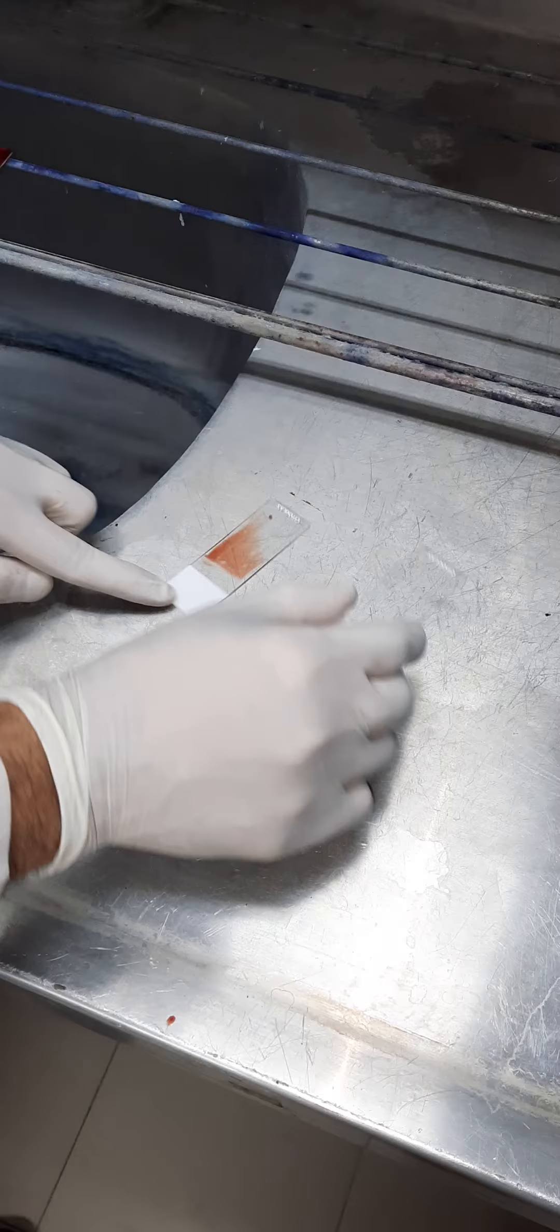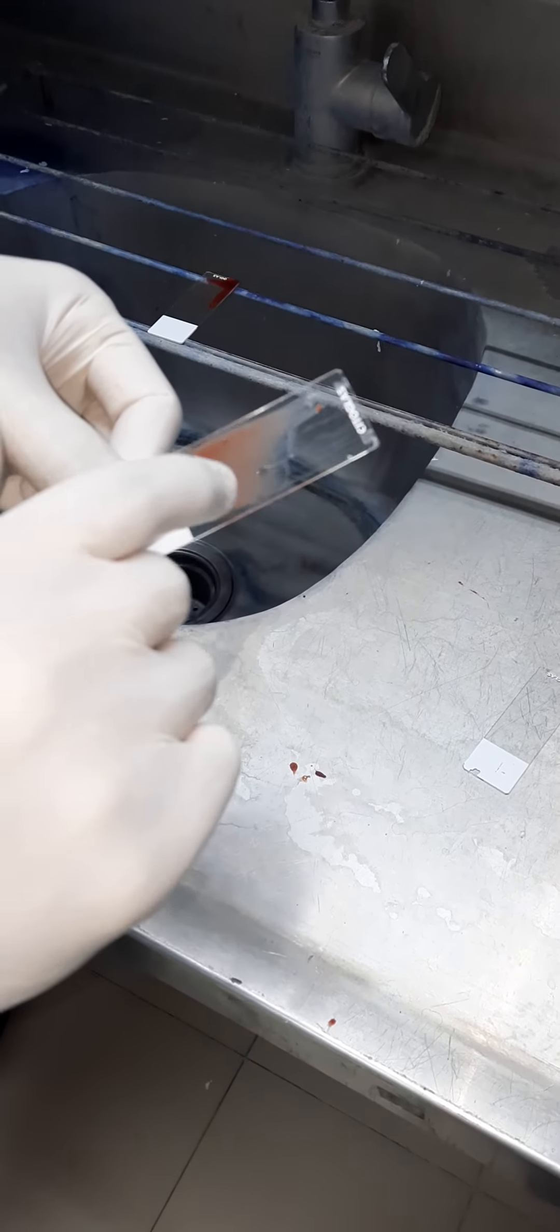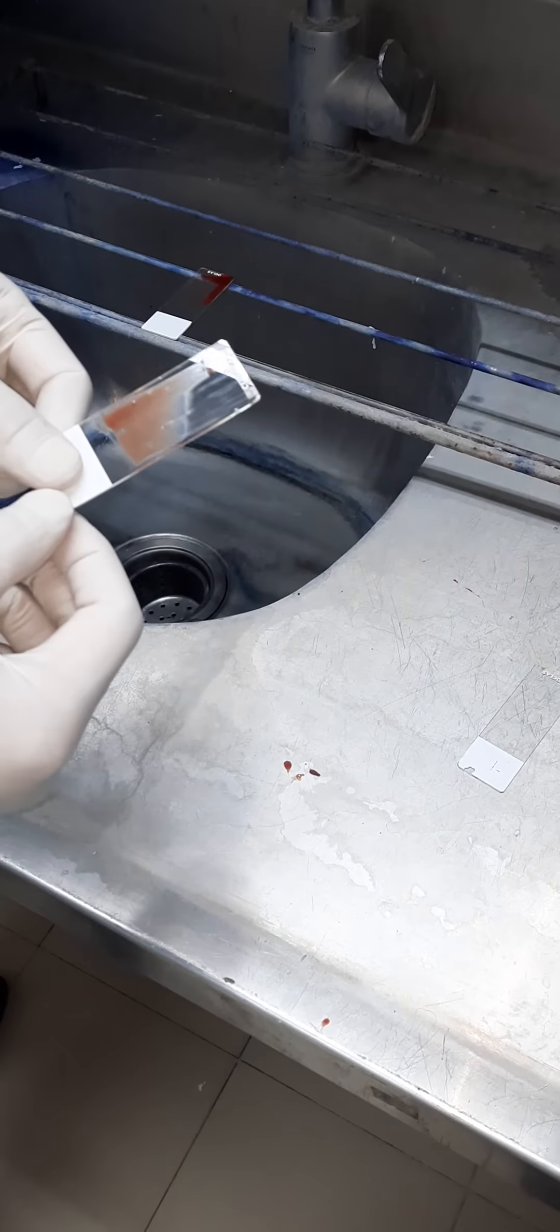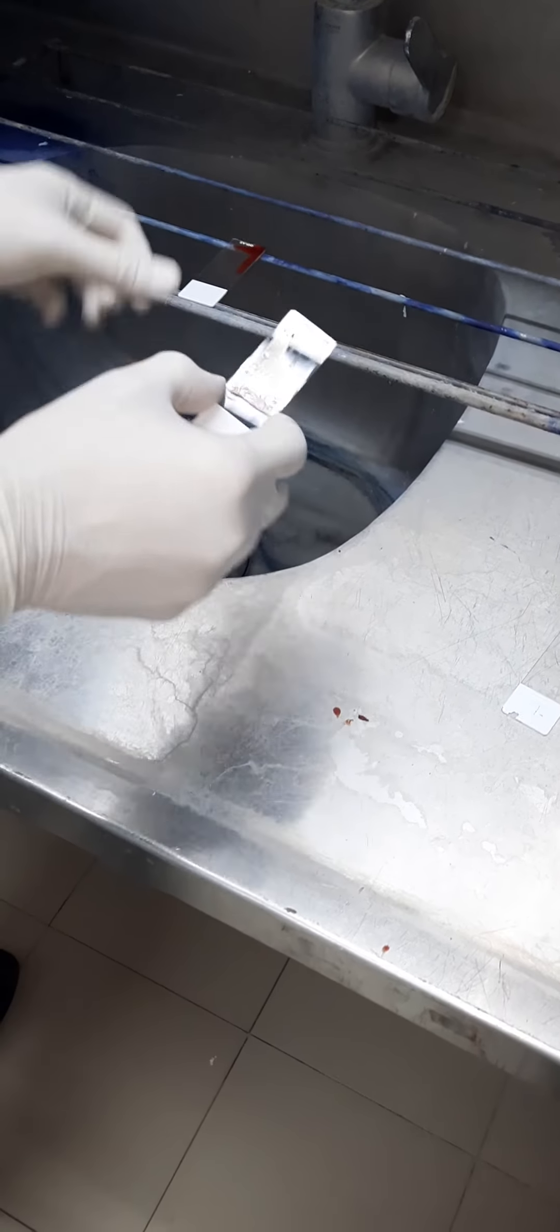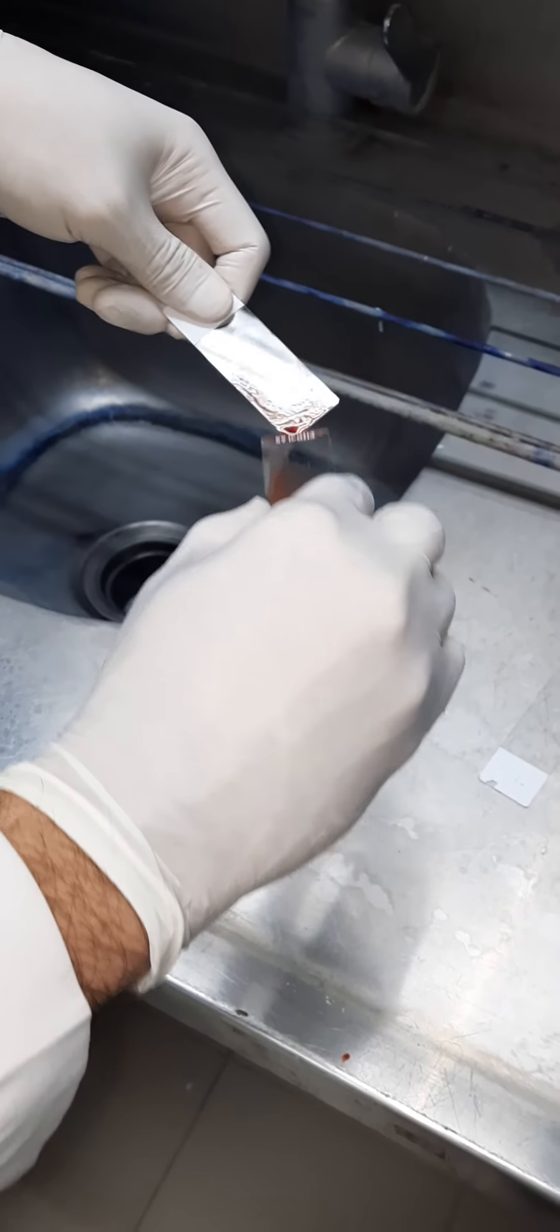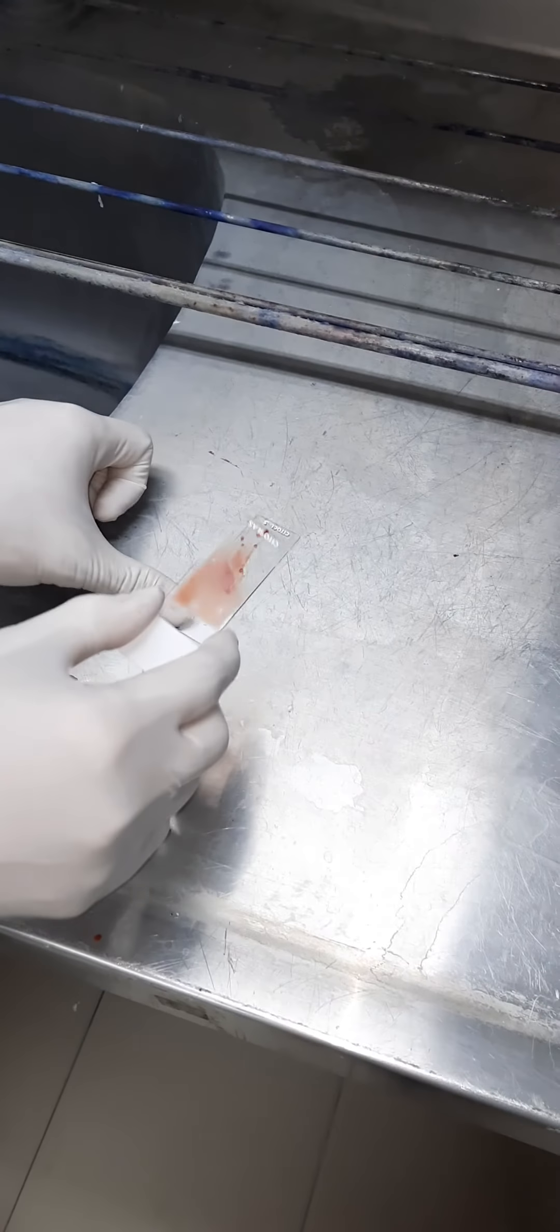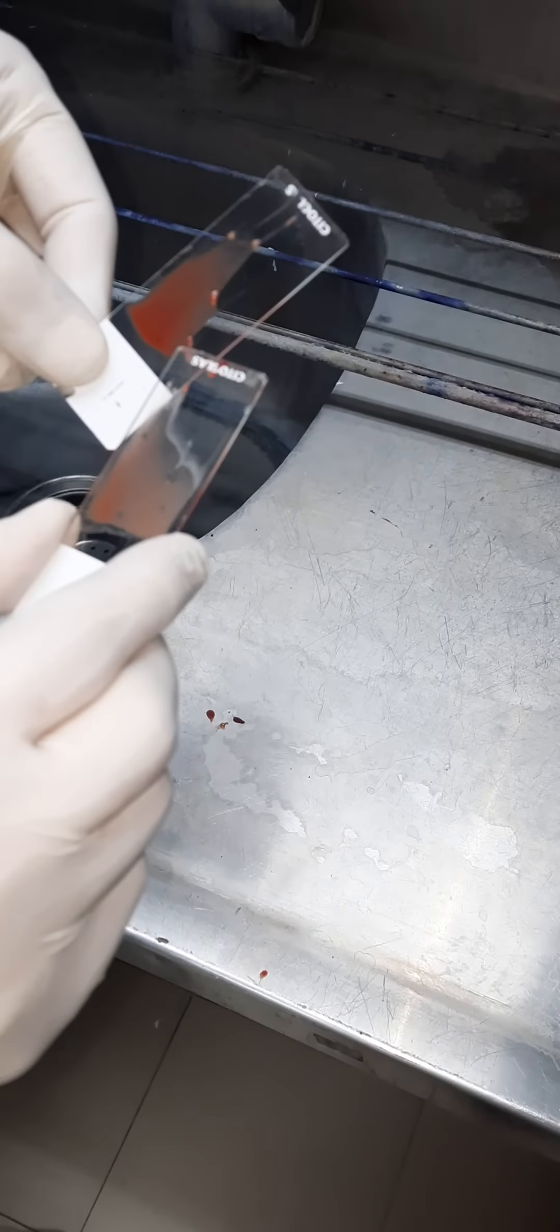See, this is an ideal bone marrow, at least having three or four particles. You can prepare others as well. For example, you can prepare more such slides and smear them. So here you have one, two, three, four, five, six particles.